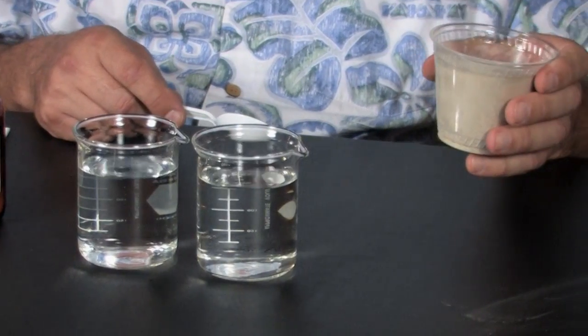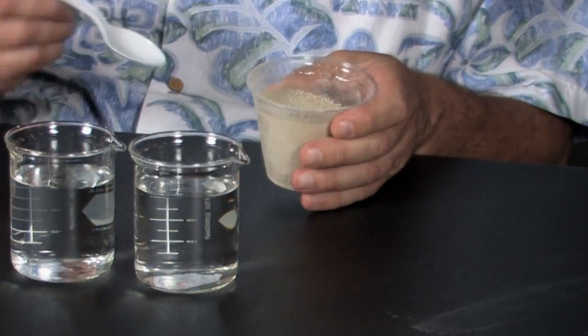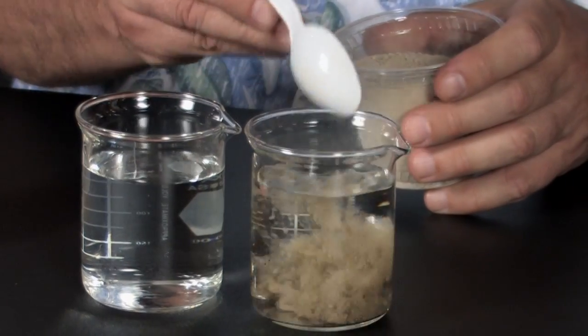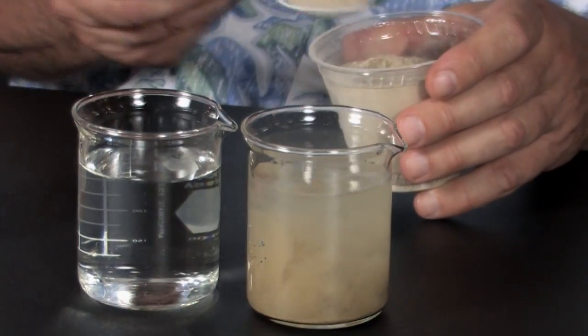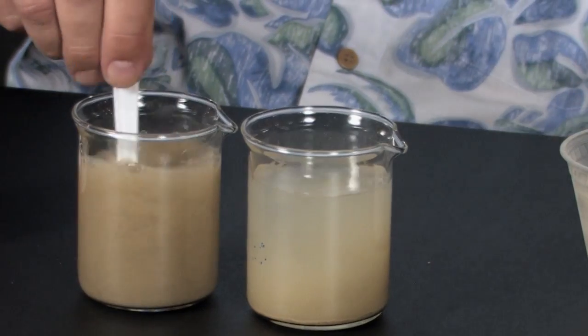Today we're going to do a demonstration of dispersion and flocculation of soil. We have here a sodic soil — a soil that's dominated by sodium, which causes the clay particles to push away from each other, or disperse. I'm going to put just about a teaspoon of this soil in each of these beakers that just contain distilled water.